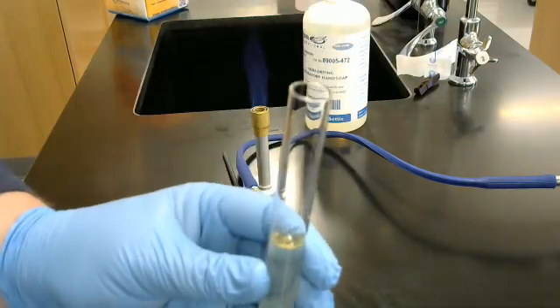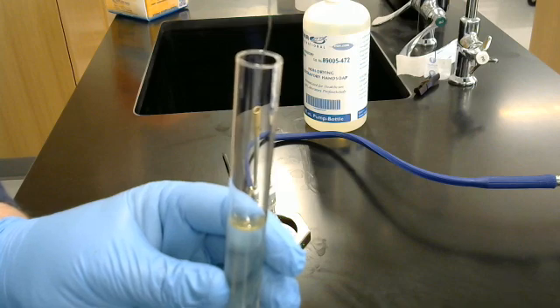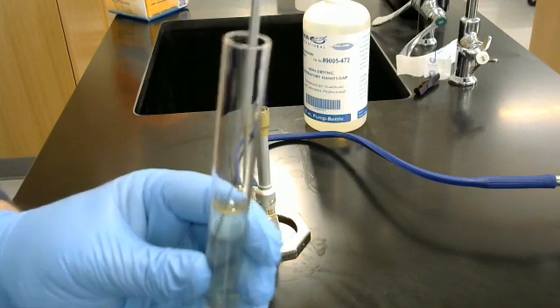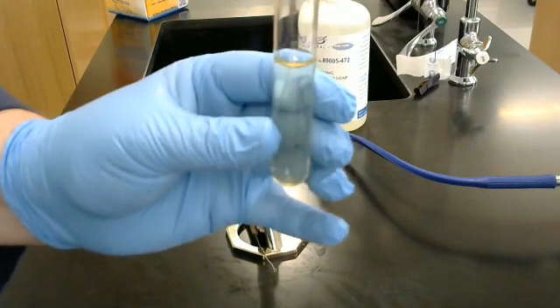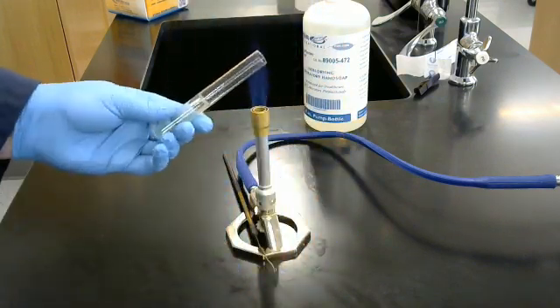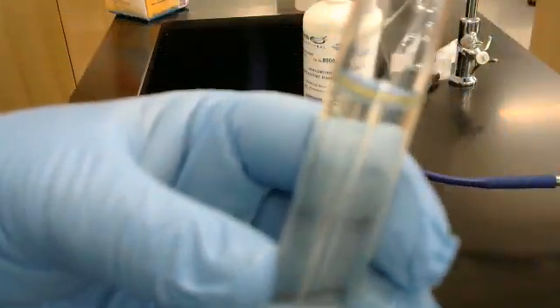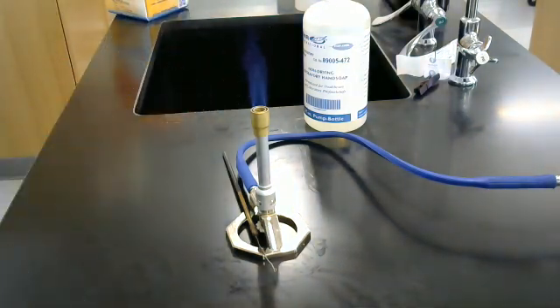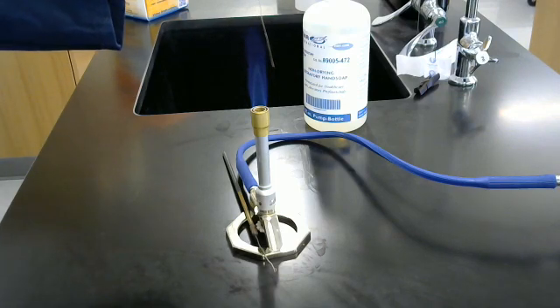And for this one, it's a simple single motion, down and up. Again, I'll show you that with the disposable tool, but you can see what sort of looks like a stab there, almost like broken glass, if not broken glass. One, two, three, cap, aseptic technique.